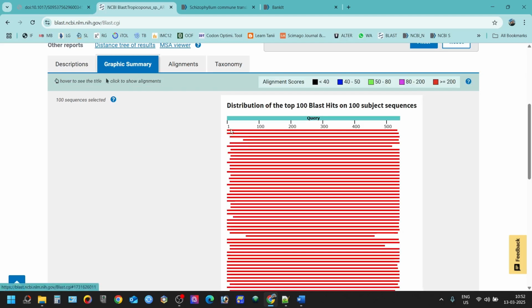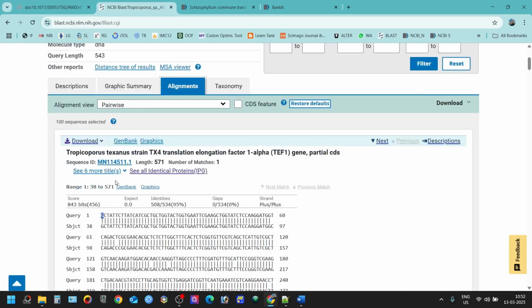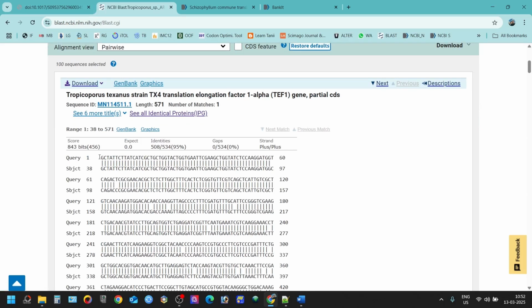You can see this is the query sequence and all the sequences here, which are aligned, how they are aligned and what they are aligned. You can see graphically here. And this is mentioning that from sequence number one, this is your sequence number one, and this is the sequence number 38 of this species. It is starting with sequence number 38. This is important in case you're going to work through here. But since we're working on our sequence, we will focus on this sequence. So you can see all these sequences aligned or not aligned, where it is different or similar.